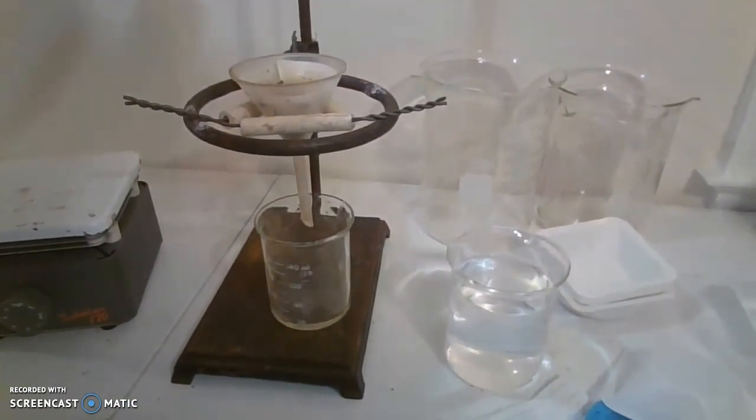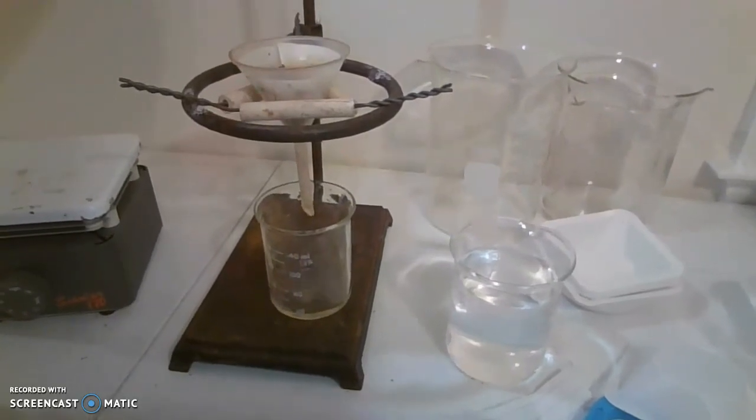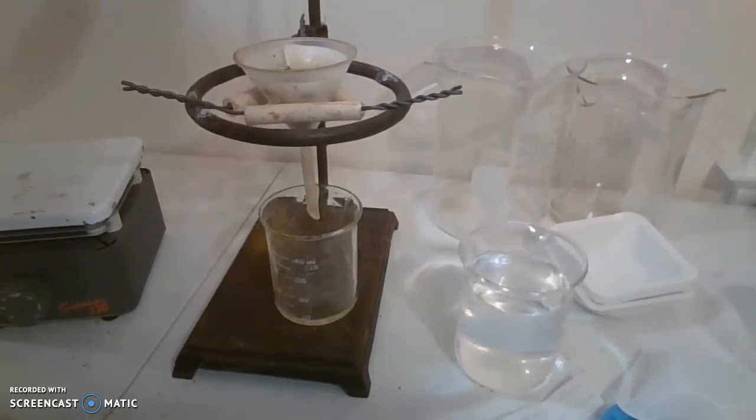back in a couple of minutes once all the water has drained through, and we'll see if that is regular water or salt water.